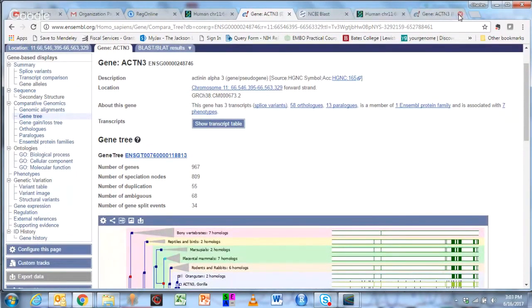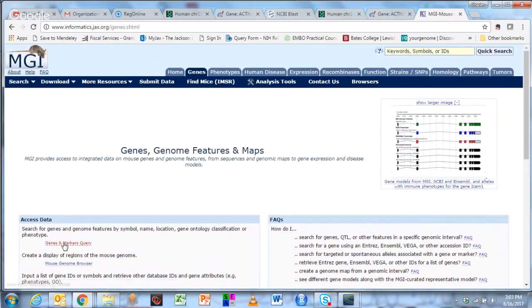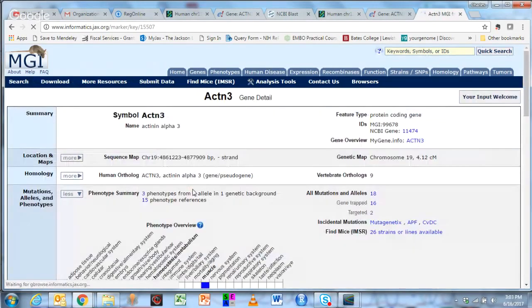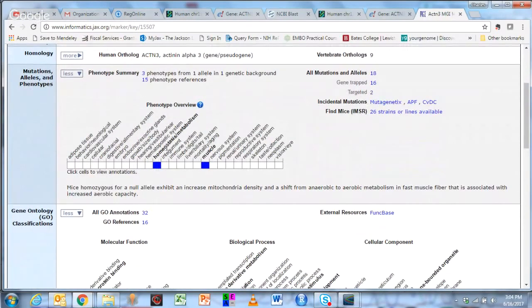And the way to look at that is to go to the mouse genome database and see if anybody has knocked this out. So I'm going to go to mouse genome, and you can see that comes up as Mouse Genome Informatics. And here we're not going to use the sequence, but we're going to look for the gene. So I'm going to go to the gene page and go to genes and markers query. And I'll put in here the name of the gene, ACTN3. And in mouse, it's on chromosome 19. And this will tell us a little bit about the gene, alpha-actinin 3, what its human ortholog is, which we know, and you can see what its phenotypic overview is.